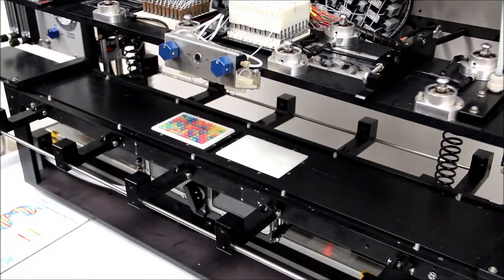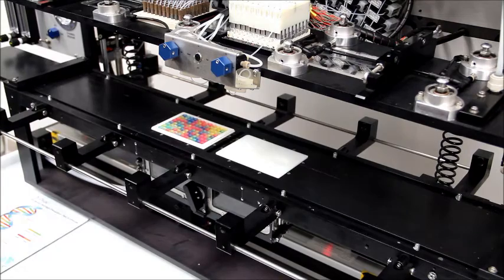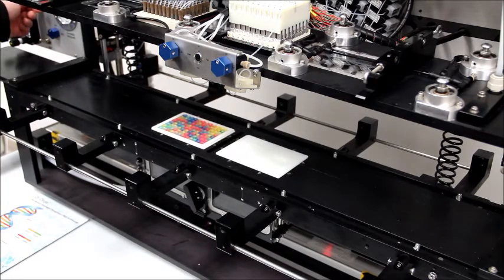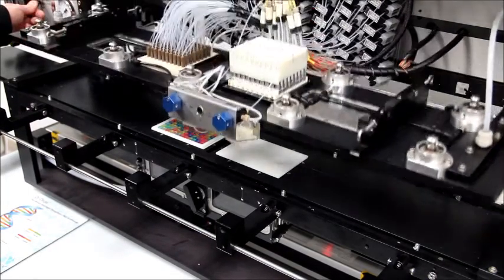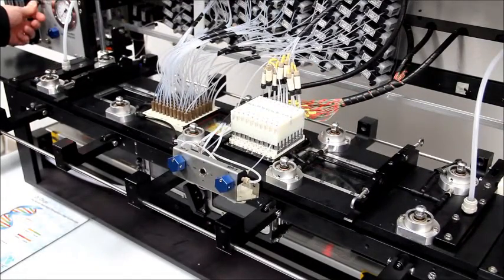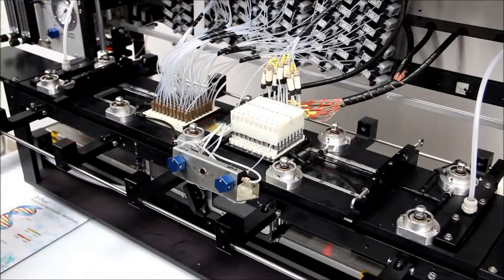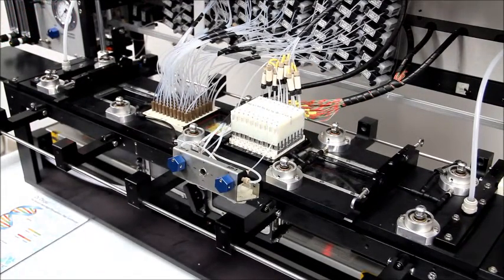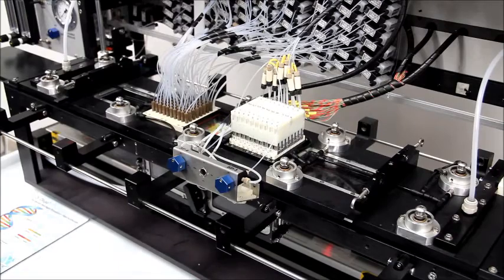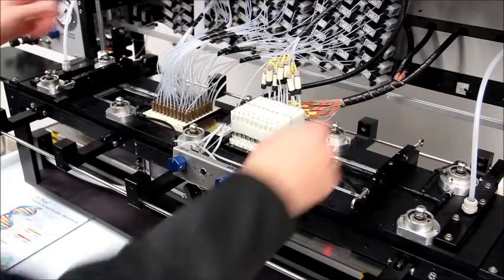When this is complete, lower the nozzle plate using the nozzle plate switch on the control panel. Then, seal the reaction chamber by locking the clamp arms in place.